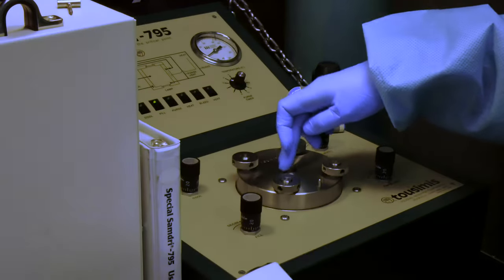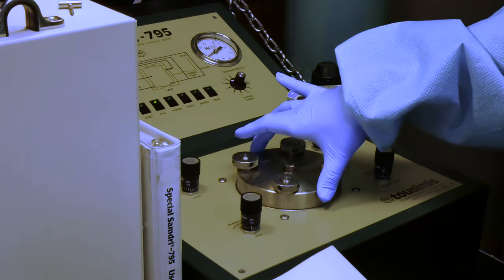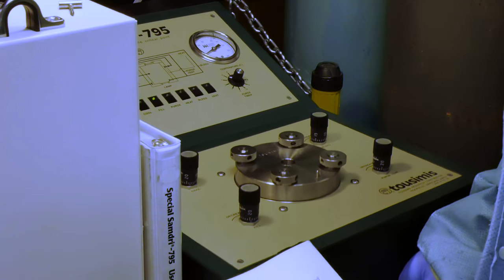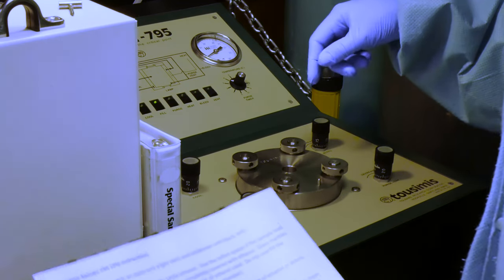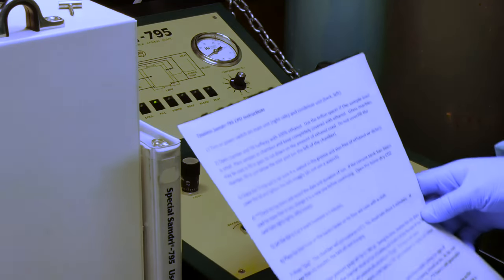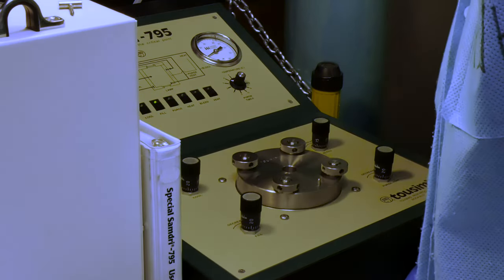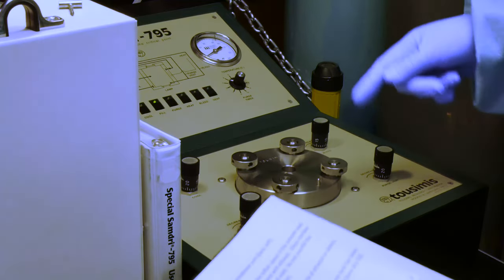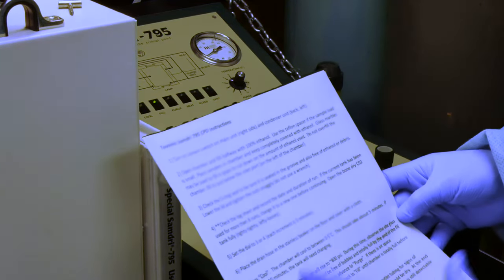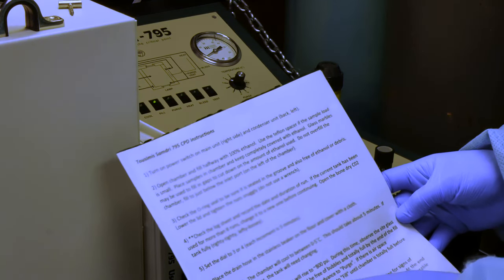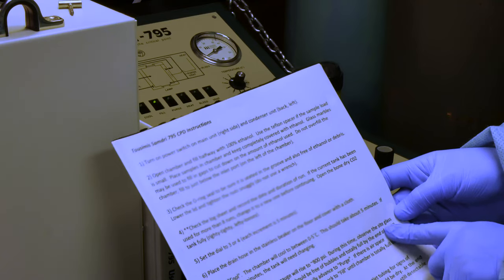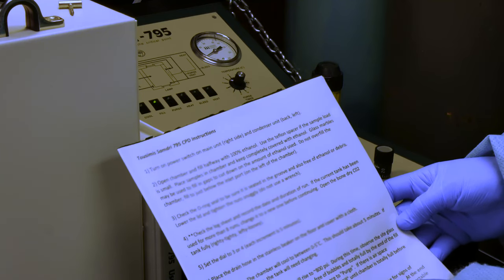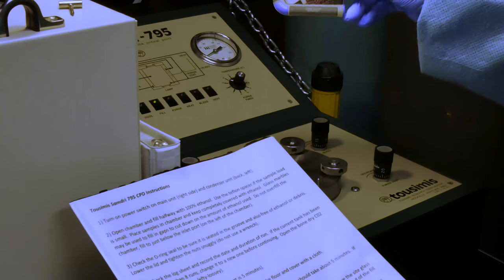Where is the bubble located? There's a window in the lid that you can see. Sometimes it requires that you lift the whole unit up to see. Currently, I'm not seeing one. There should still be one in there at this point. Yeah, it's slight. I'm having to rock it. But I do, in this process, want to continue to see that get smaller and smaller. So it's indicated during this time, observe the sight glass on the chamber lid. The chamber should be free of bubbles, totally full by the end of the fill time, which is approximately two minutes. And we are close to that.